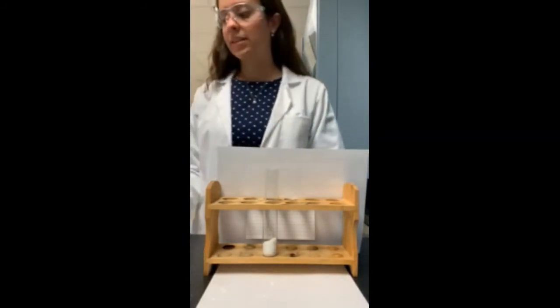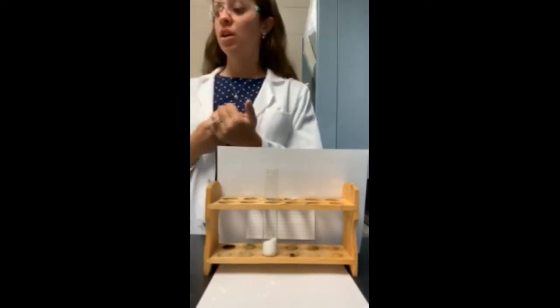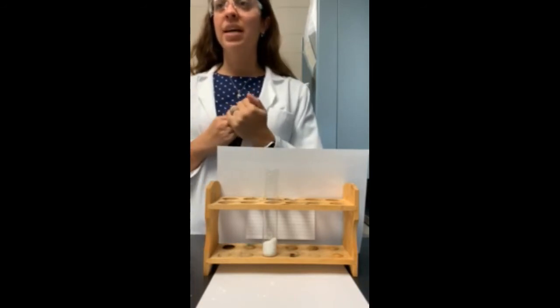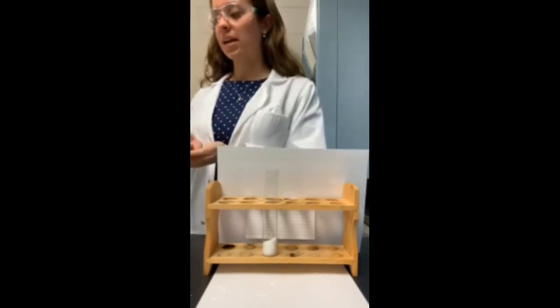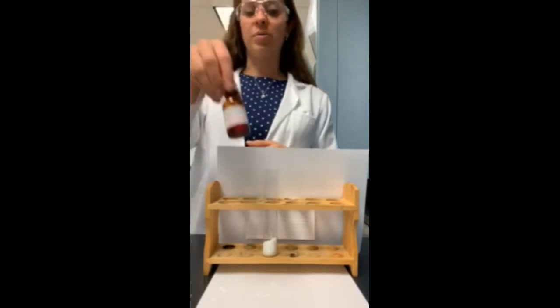Now, when you mix a metal oxide, like calcium oxide, and water, you always will form one of two things, either an acid or a base. Now, what we're going to figure out here is which one is it? Does a metal oxide and water form an acid, or does metal oxide and water form a base? And how we're going to do that is we're going to use something called phenolphthalein, which is an indicator.